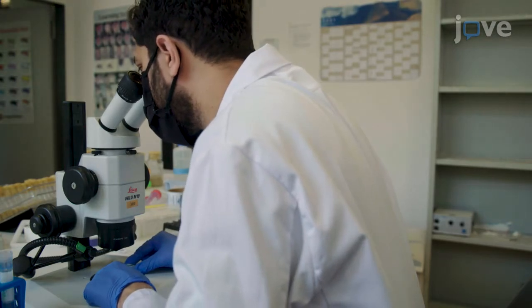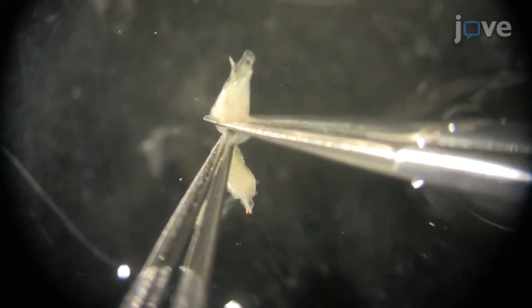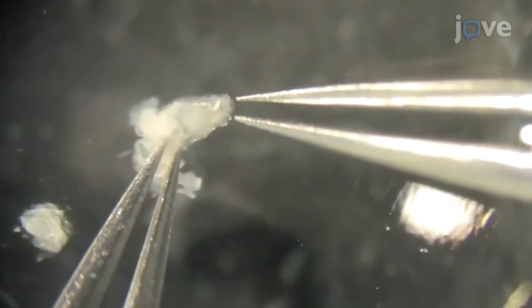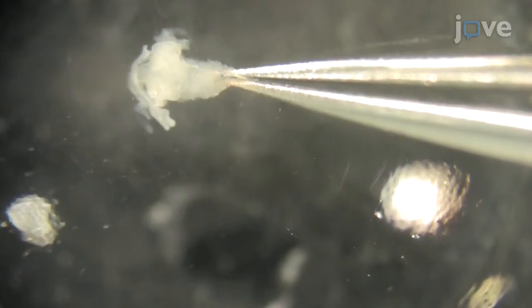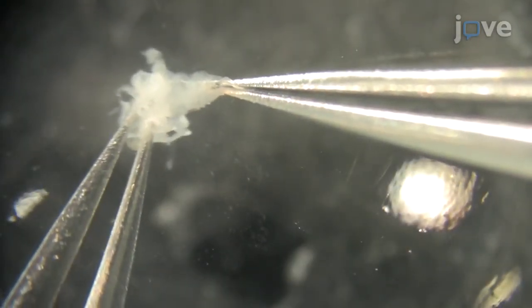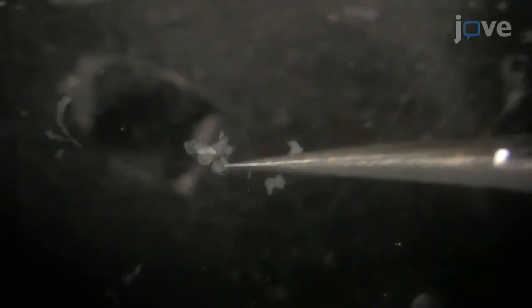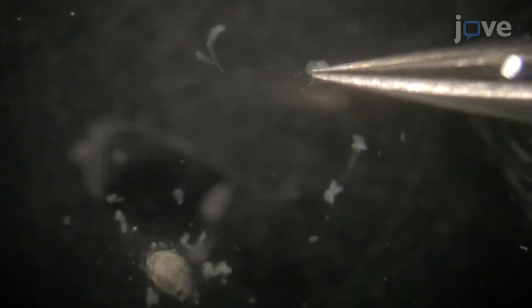Next, under a dissection microscope, use fine forceps to remove 3/4 of the lower body of the larva. Then gently grab the larval mouth hooks with one pair of forceps and hold the cuticle at the other end with the other pair of forceps. Turn the larval head inside out by pushing the mouth hooks inward and simultaneously peeling off the tissue at the other end. Observe the larval brain with attached imaginal discs. Remove other tissues attached to the brain and transfer the brain to the subsequent consecutive depression with SM.